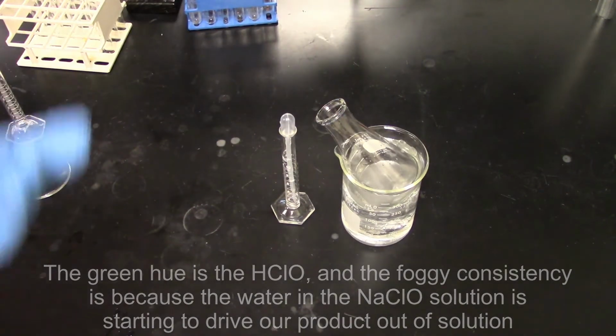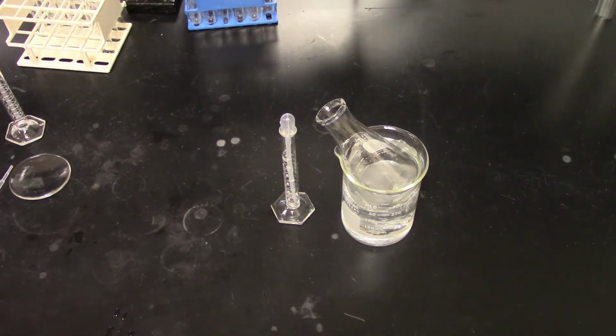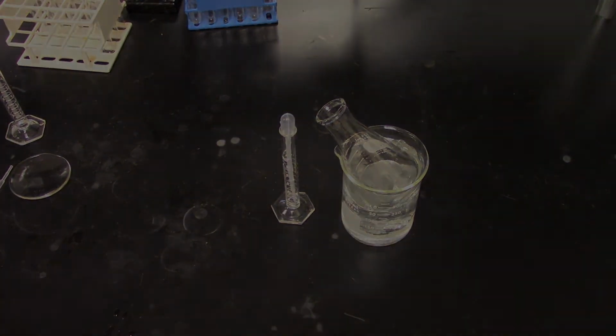Again, we're going to keep the temperatures low here, and the reason is that the HClO is pretty unstable, and as we add our bleach to the concentrated glacial acetic acid, it's going to want to react. By keeping the temperatures low, we ensure that it doesn't get warm enough to react away our hypochlorous acid before it's had time to react with our diphenylmethanol.